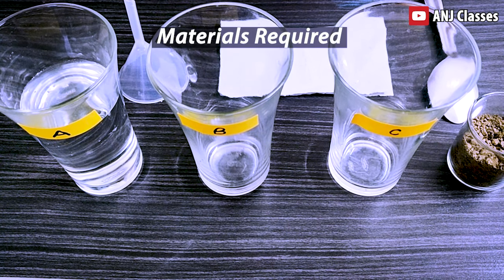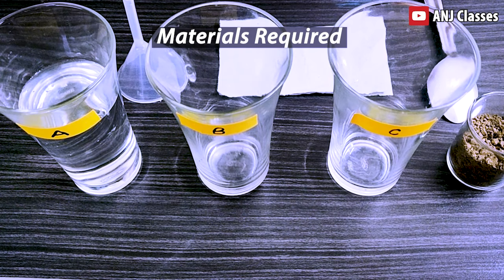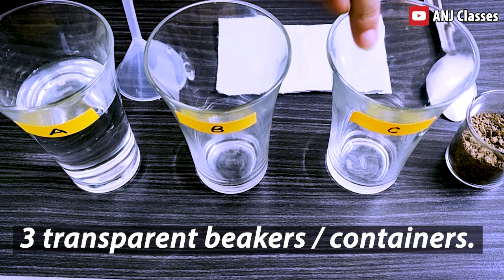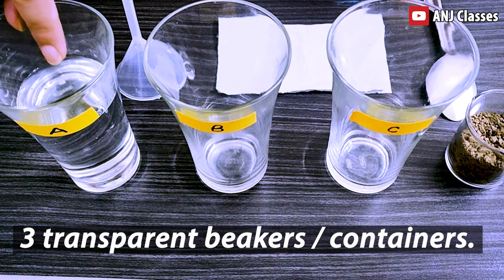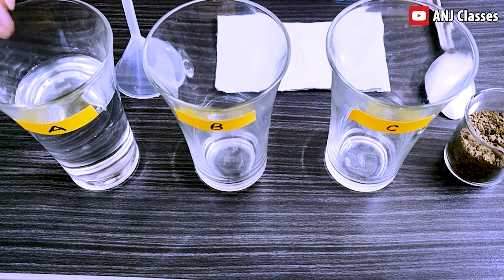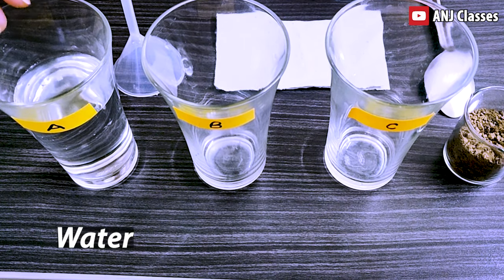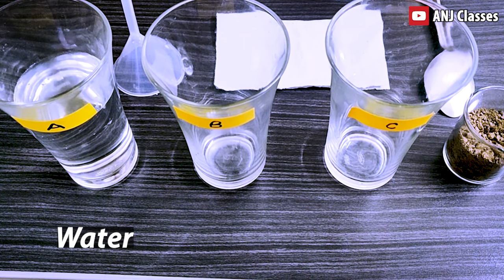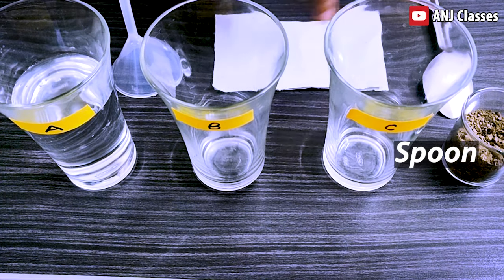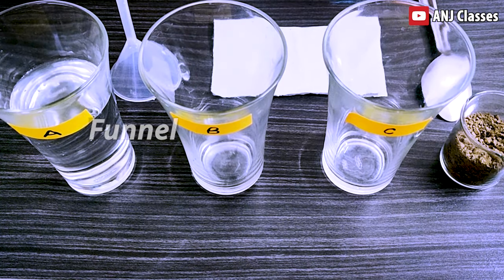The materials required for this activity are three transparent glasses, which we will label as A, B and C. Glass A we will half fill with water. We also need soil, a spoon, filter paper and a funnel.